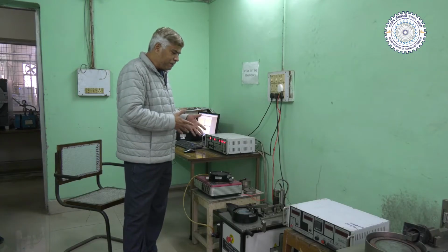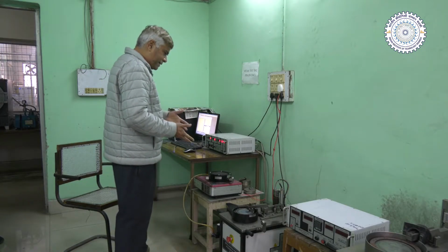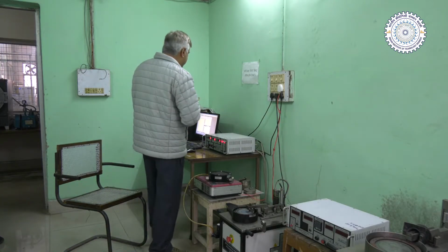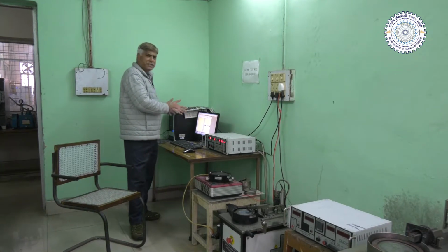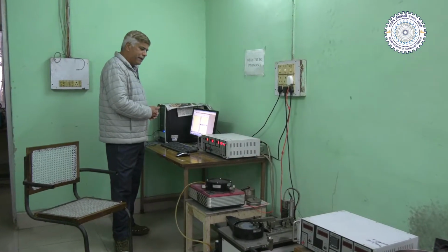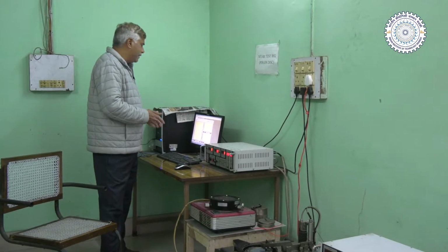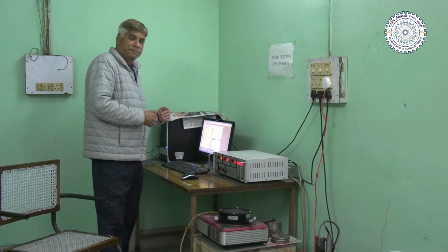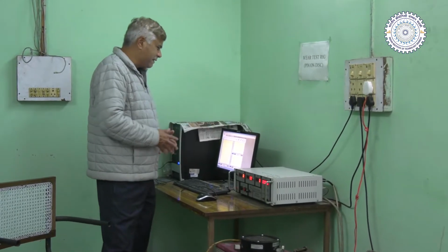And these parameters are basically acquired. We can see here one of the software screens with the machine itself, wherein we can see the wear in terms of the loss of dimensions, basically in micrometers, which is taking place. Then there is the friction force.